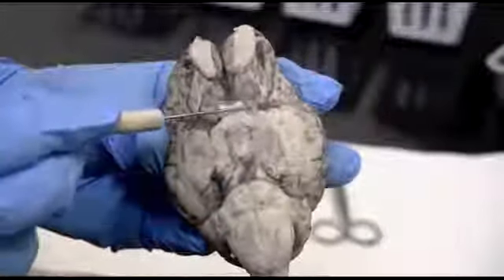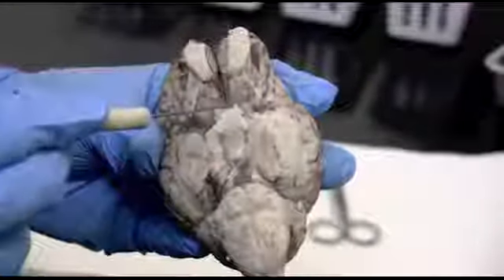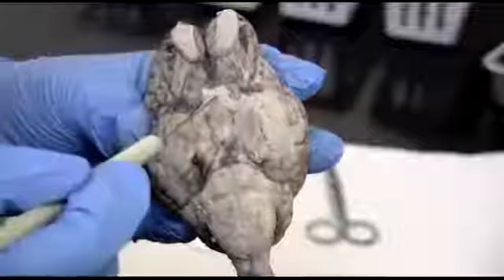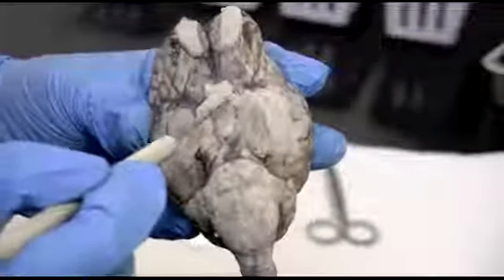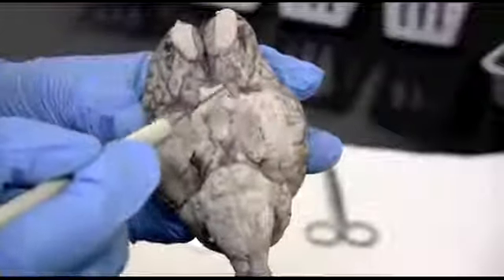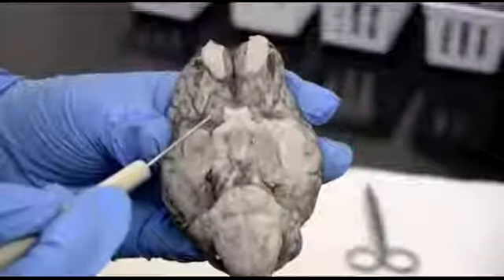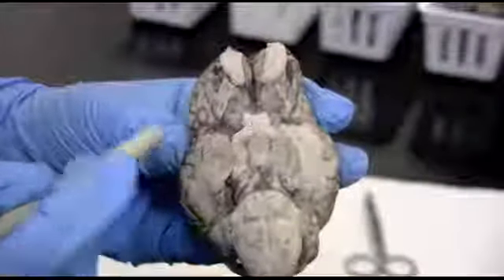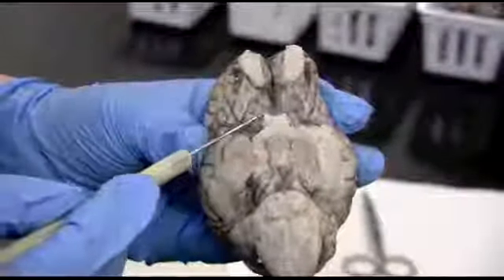When it's coming out from the eyeball to the chiasm, it's the optic nerve. When it's leaving the chiasm, it's called the optic tract. And then this X is actually the chiasm. Okay, so that was the optic nerve. That's cranial nerve 2. Remember, cranial nerve 1, cranial nerve 2.